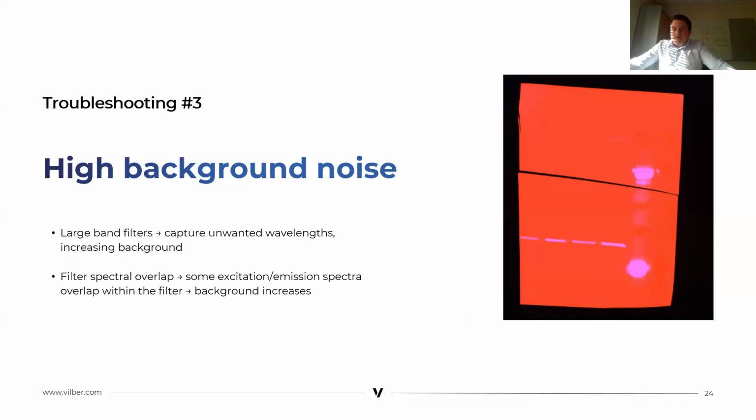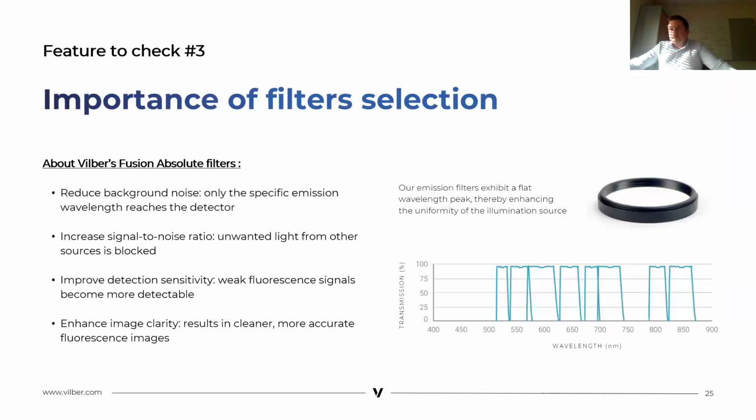The third troubleshooting in fluorescence is the high background noise. By using a large band filter, you will capture unwanted wavelengths, which increase the background because you will also capture the excitation of your module. To avoid that, Fusion Absolute filters help reduce background noise by allowing only the specific emission wavelength to reach the detector. They increase the signal to noise ratio by blocking unwanted light from other sources, like the excitation. So it's very important to look at your filter and its blocking range.